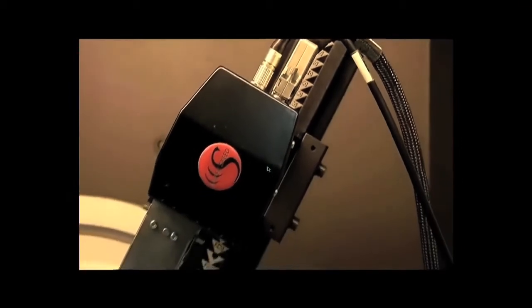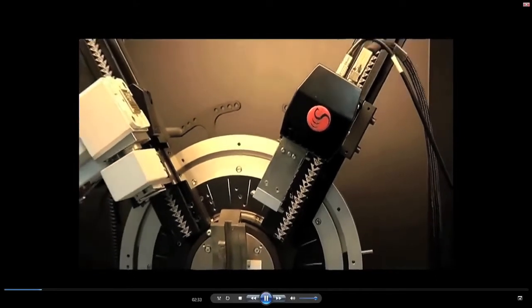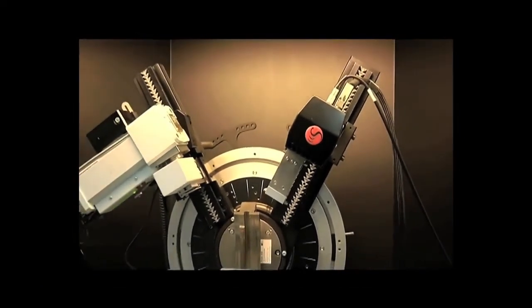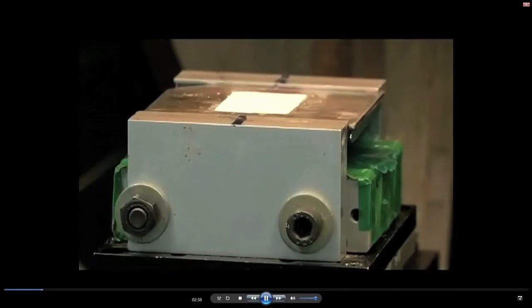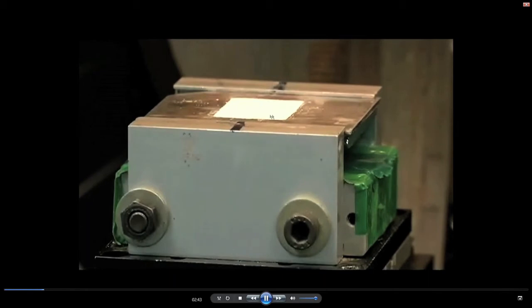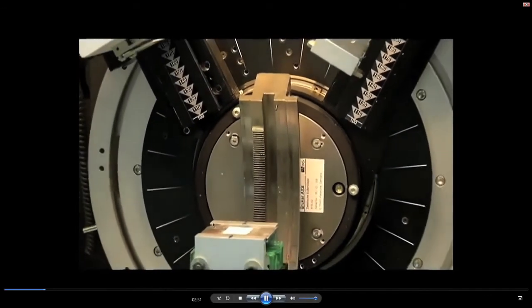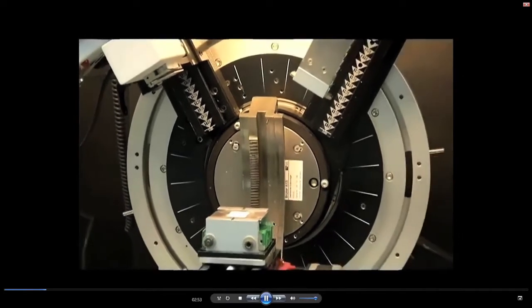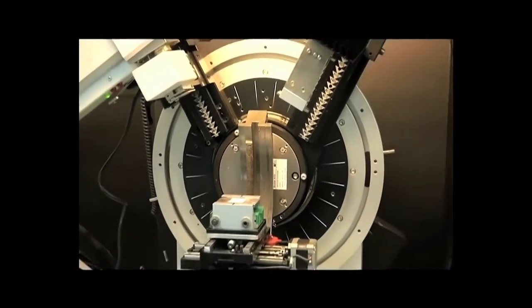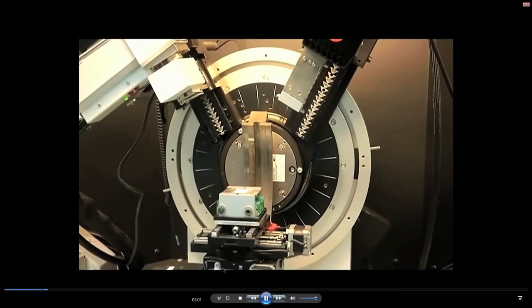And then what you are now seeing is everything in a close-up shot, and do not worry, you will be seeing this for a very long time. So, you get the details. So, this is the specimen stage where your specimens are kept, whether it is a bulk sample or a powder sample. A bulk sample is directly kept on this, whereas the powder sample is mixed with some medium and kept on a glass slide or something like that, and this is a specimen stage. We will talk about it in much more detail.